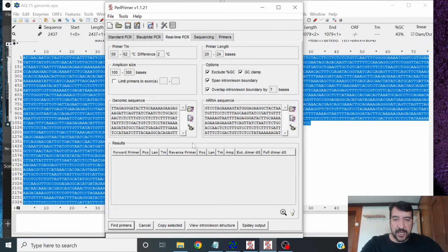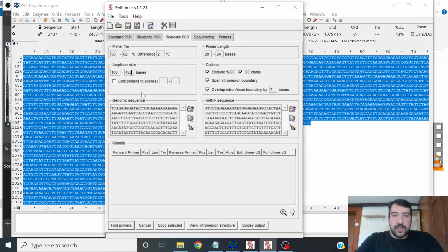So now that we've pasted in our sequences, there's a bunch of parameters here, and they're relatively simple. You could probably leave all of these as the default settings. That would be fine. I often might change this to 450 base pairs to make amplicons a little bit bigger when you're using SYBR Green or EvaGreen, which is the better of the two. With an intercalating dye in qPCR, a little bigger amplicons can actually make more signal with a dye like EvaGreen or SYBR Green. Another option you could play with is the primer TM, which you could set as low as 55 degrees. I wouldn't really go lower than 55 degrees if you want specific amplification.